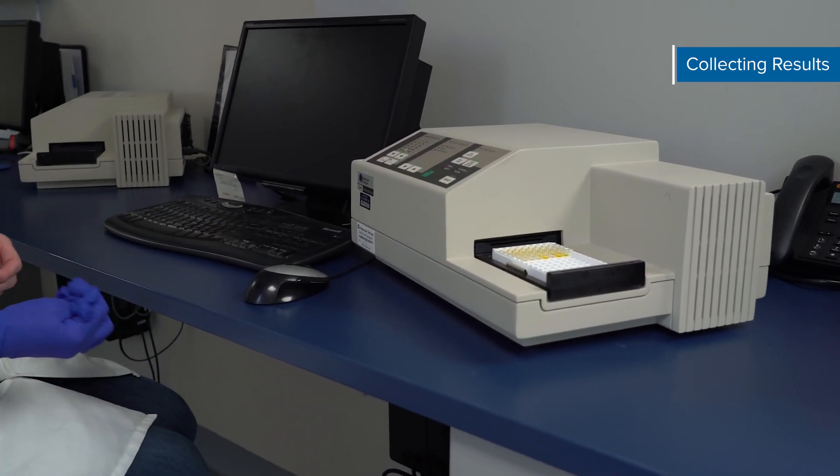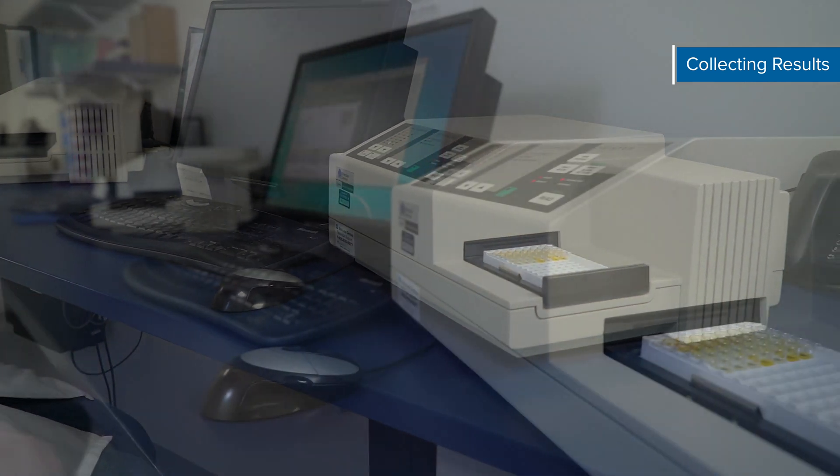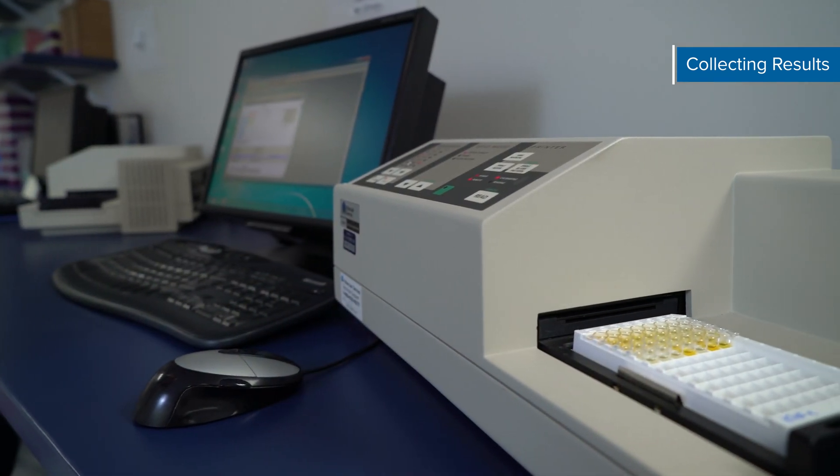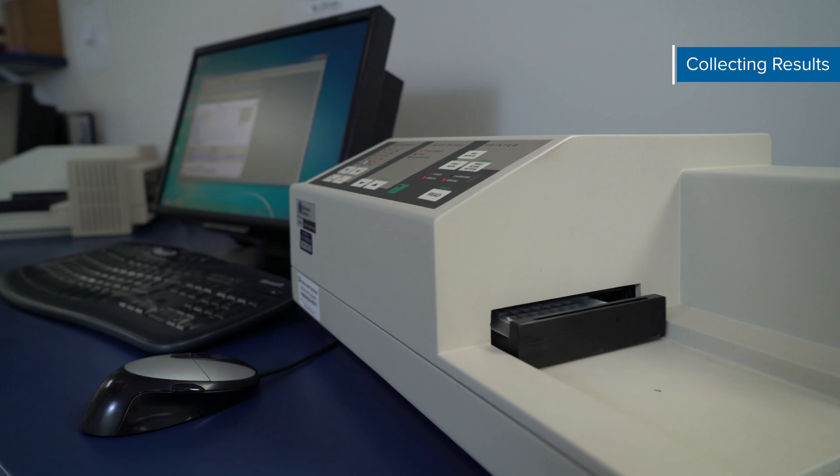Now you can collect your results. Determine the optical density of each well within 30 minutes using a microplate reader set to 450 nanometers.